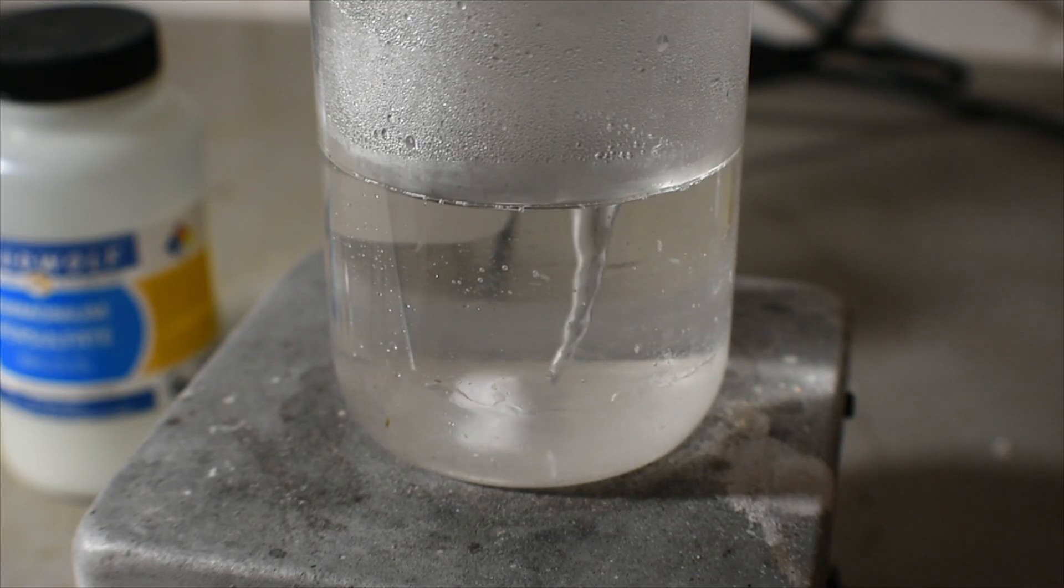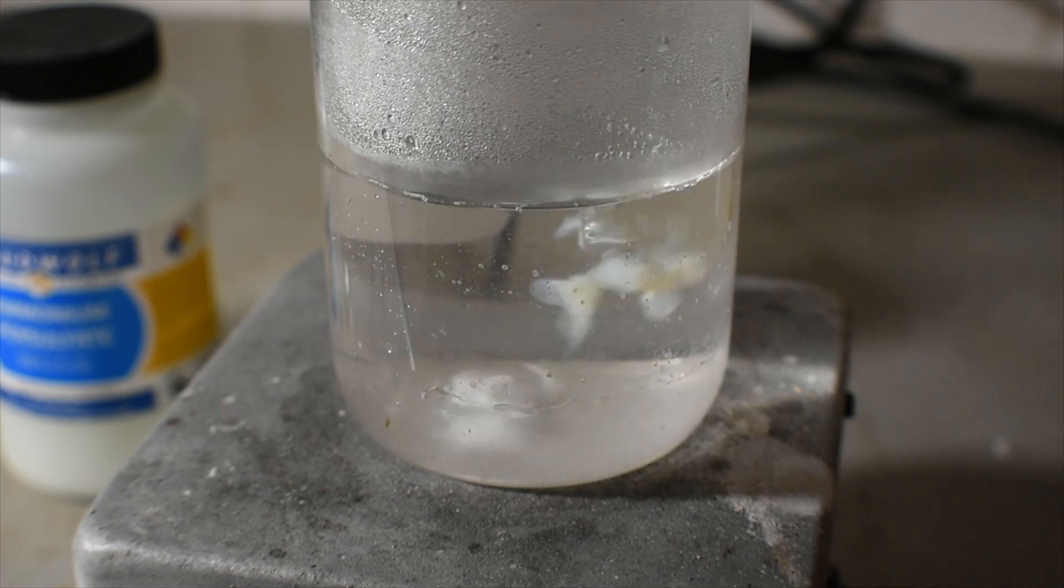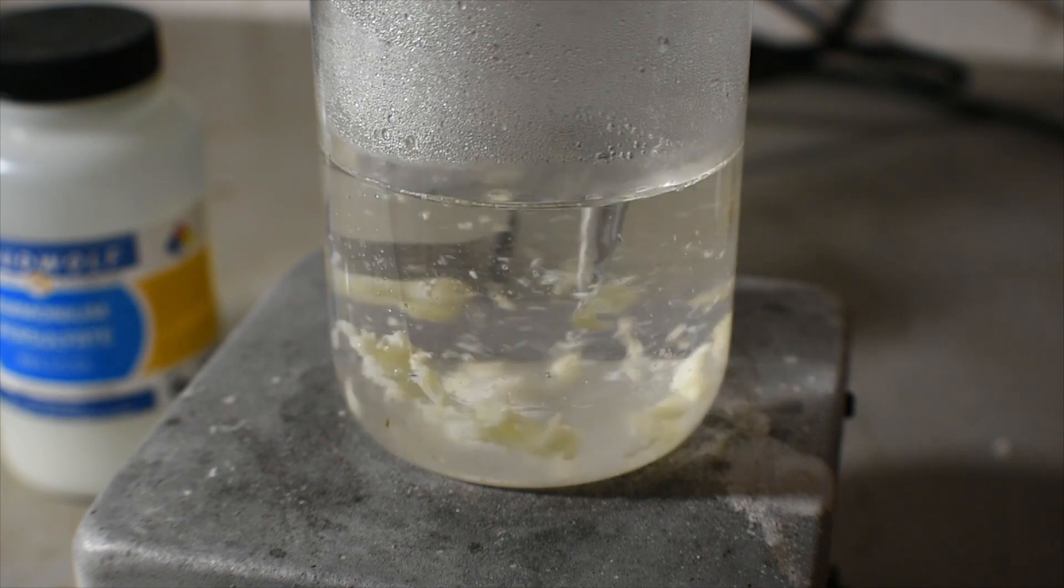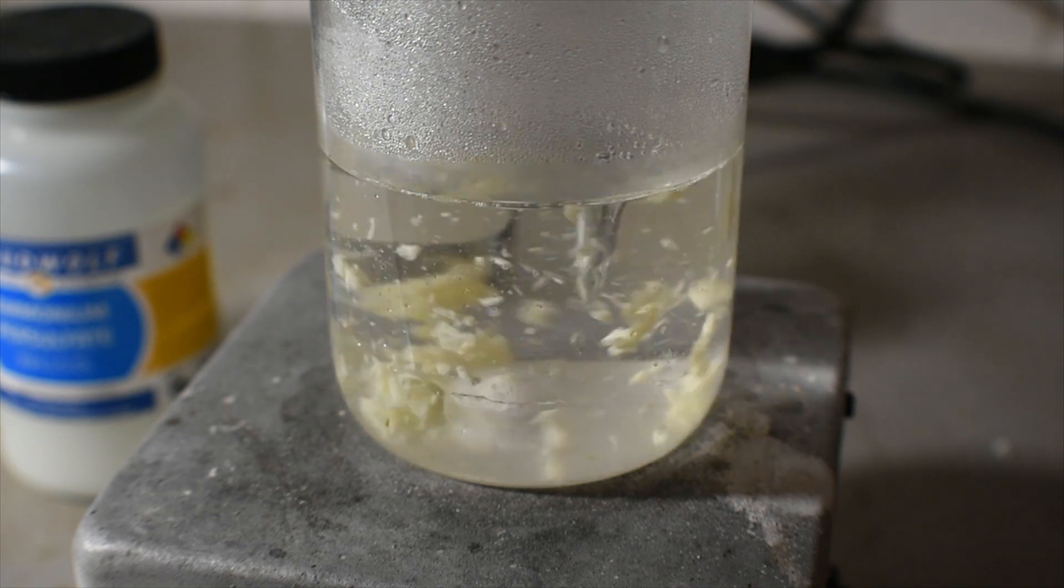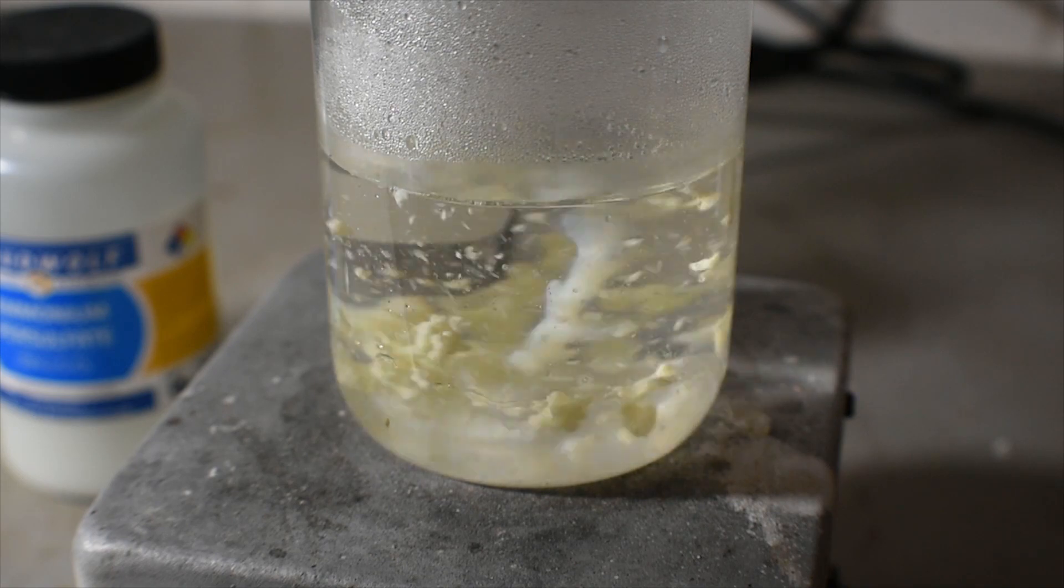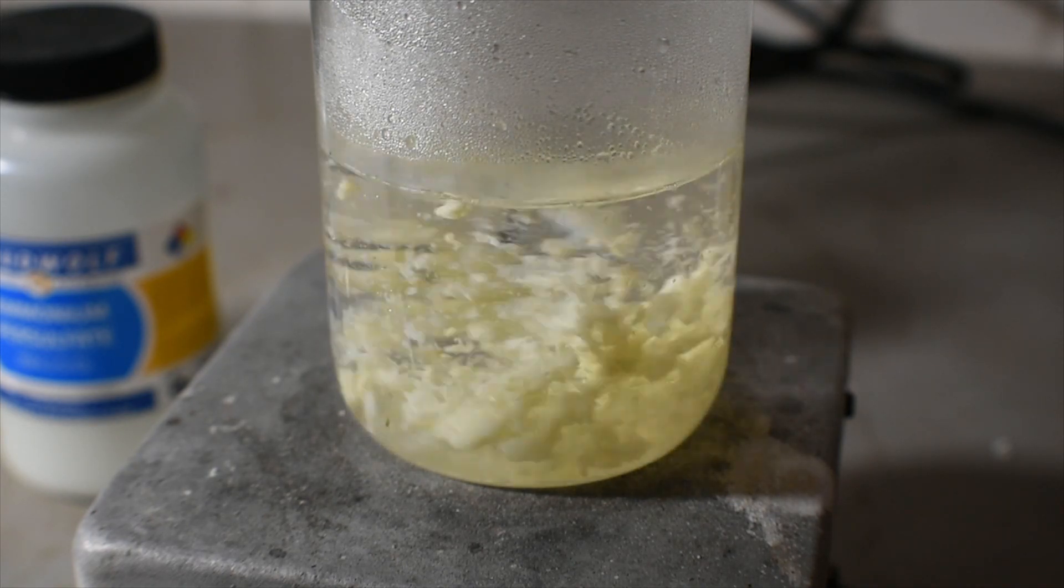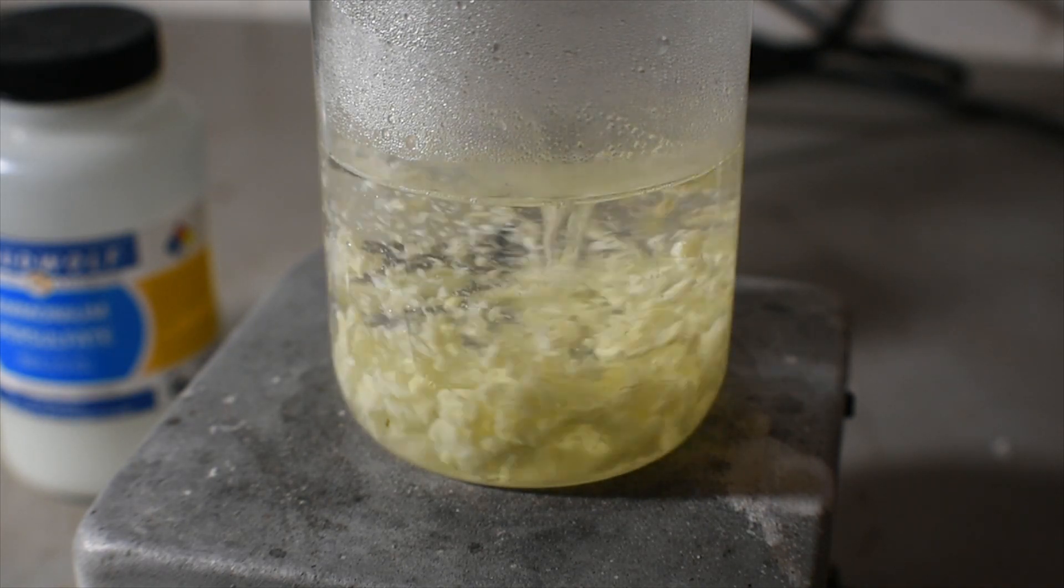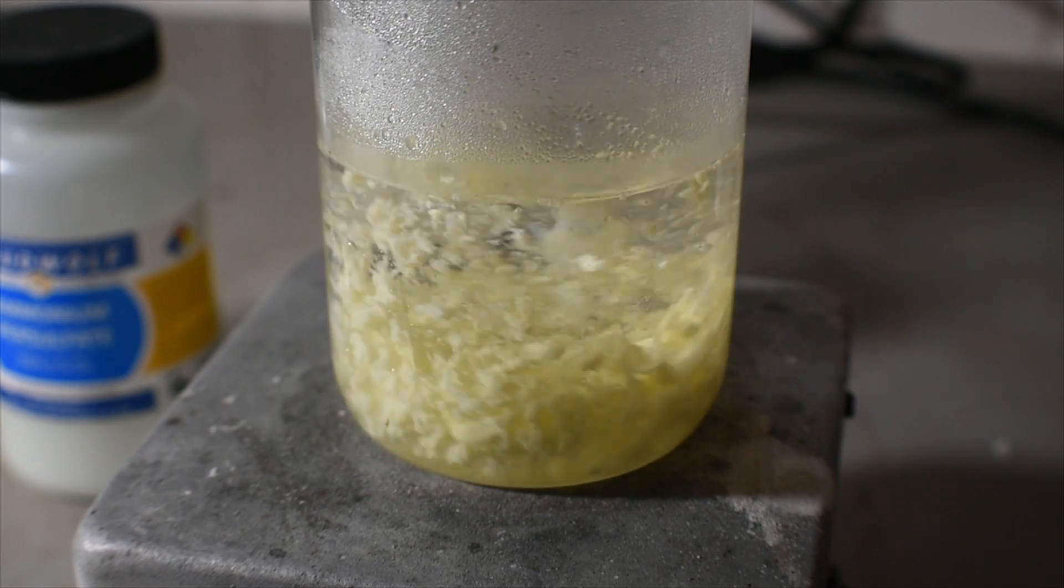Eventually, I did the opposite of the paper and added the silver nitrate solution to the ortho-phenanthroline mixture. It formed sort of a scrambled egg looking solid, and I believe this is a silver one complex of some sort.